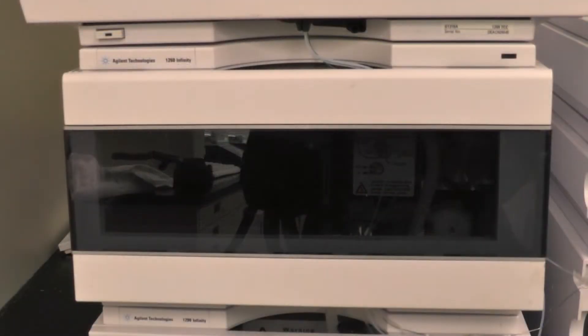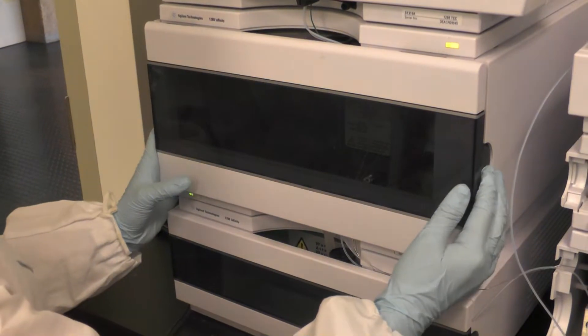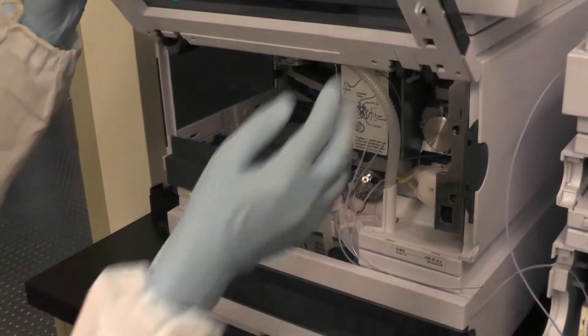Samples are loaded using the auto sampler. Here we use 2ml vials fitted in 54 well plates.